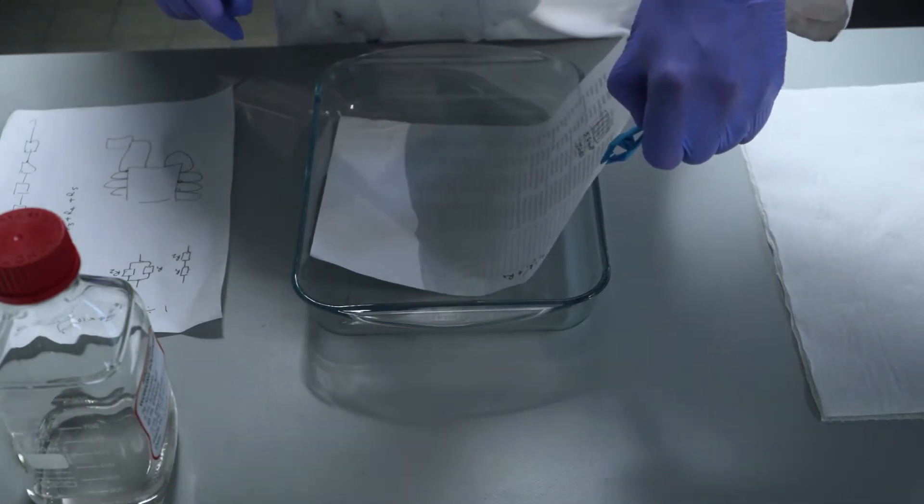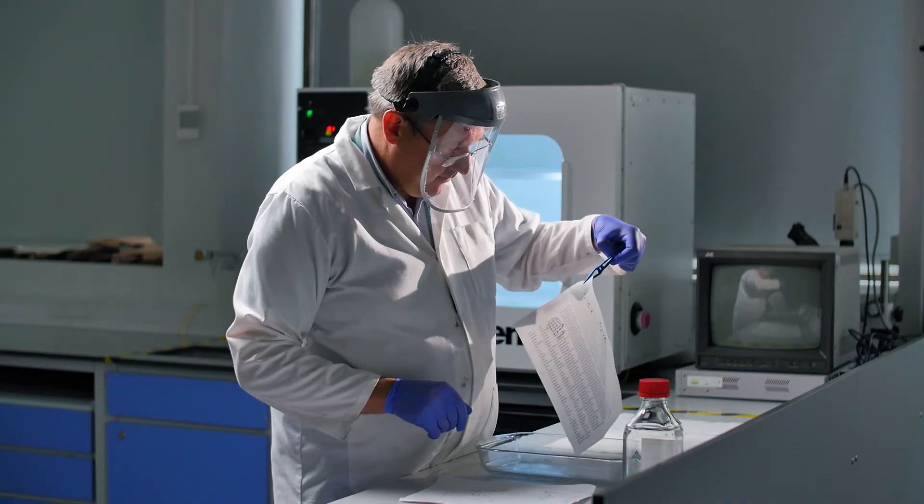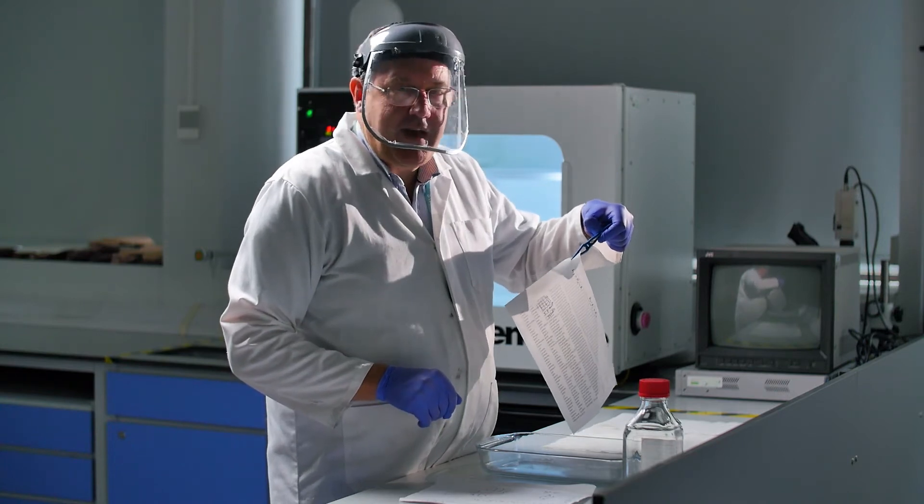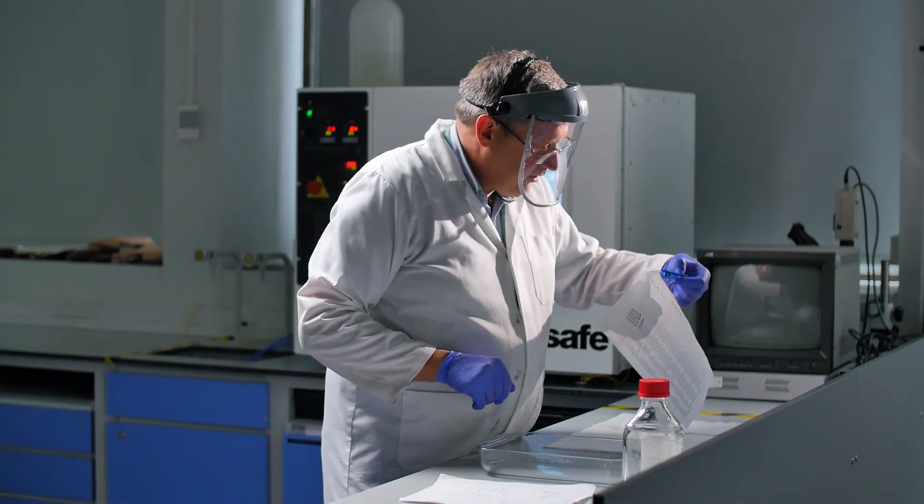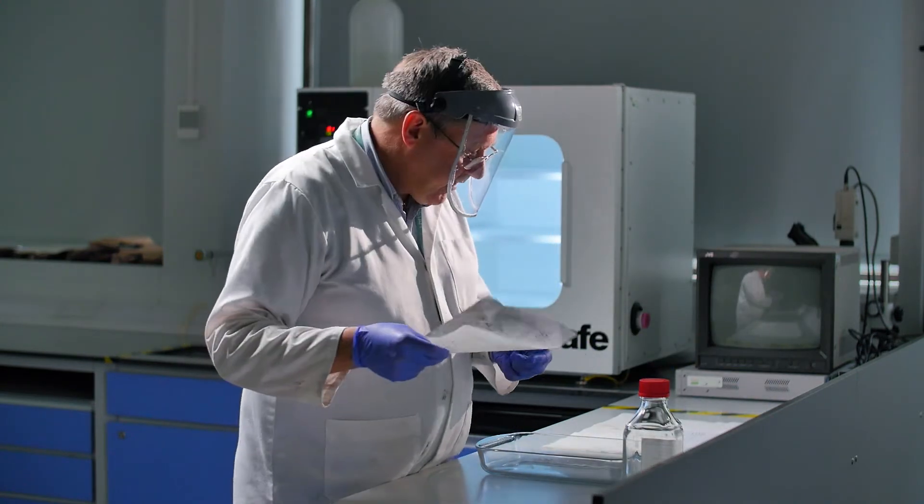Making sure that all the paper is wetted by the solution as I pull it through. I'll just let some of it drip back into the tray and then put it to dry on this tissue paper here. I'll just do that with the second sheet of paper.